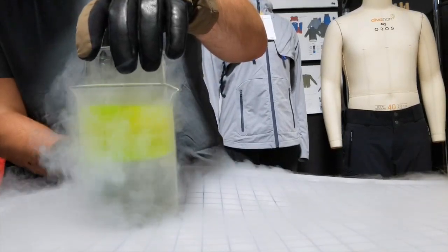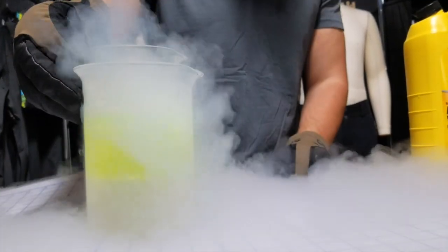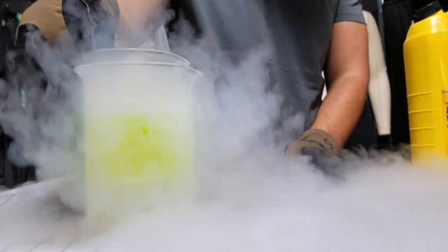Oh, we're getting big bubbling on the table. I can't see what's happening in there. It looks so rad.